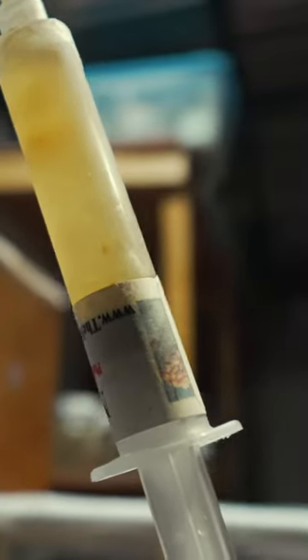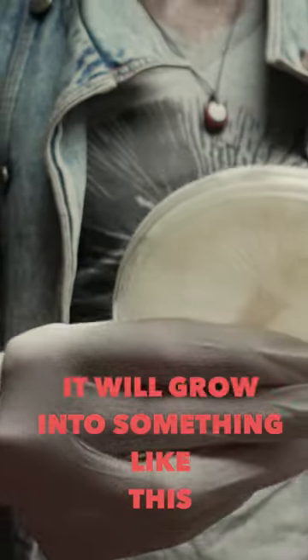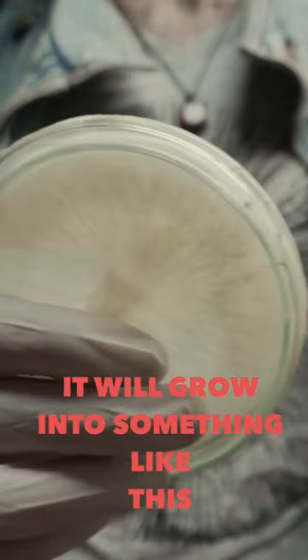So this is a starting point, and then you can inoculate — bigger drop, and drop here — and it will grow into something like this. Can you see the white fluff? That's a little baby fungus finding first life.